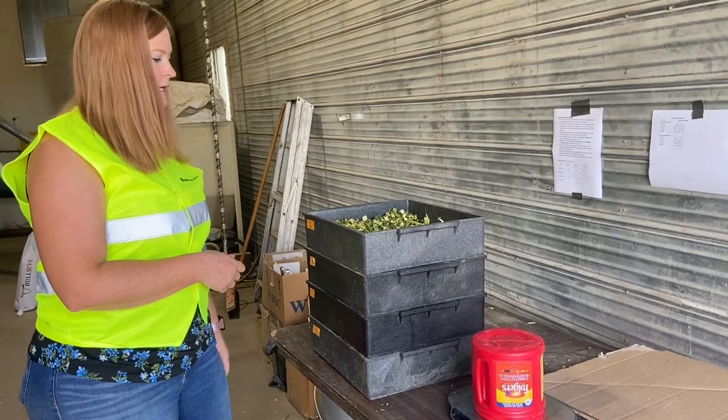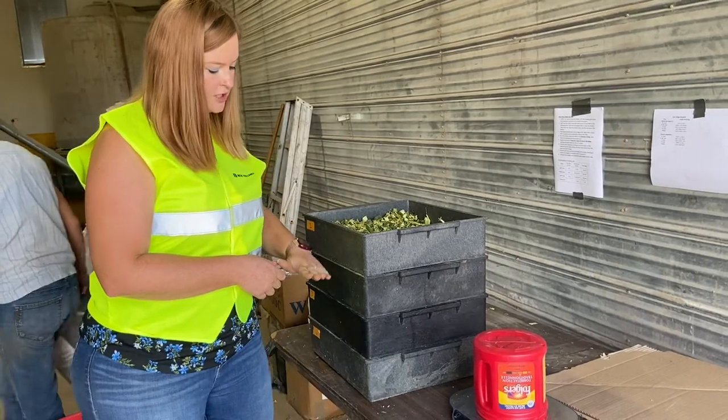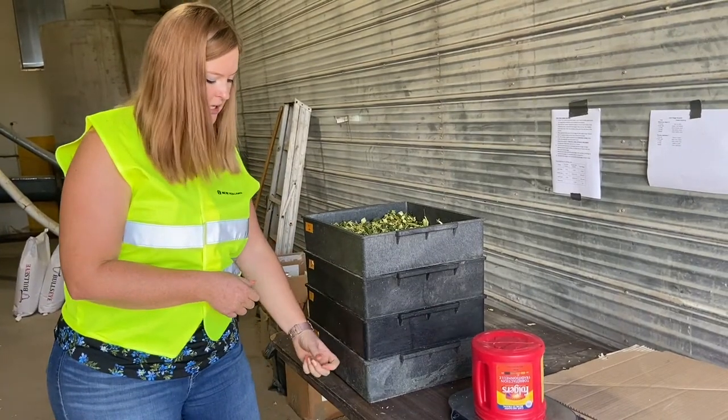You want to shake enough so that the material moves over the sieve — in the 1st, 2nd, and 3rd tray — because they need to get to the bottom as well.